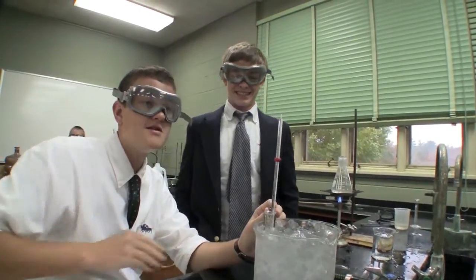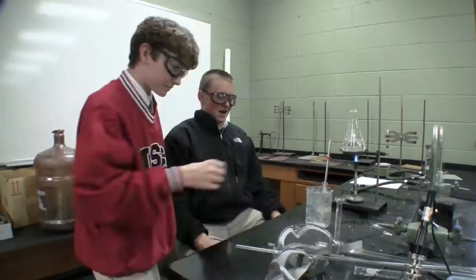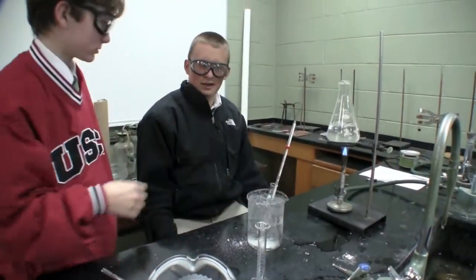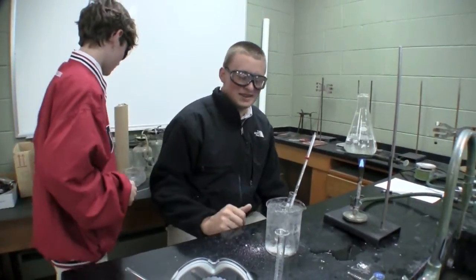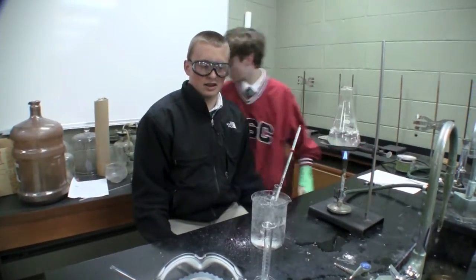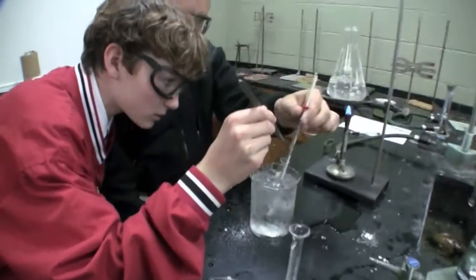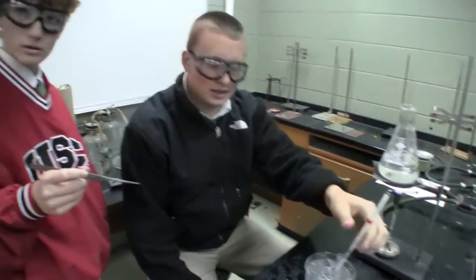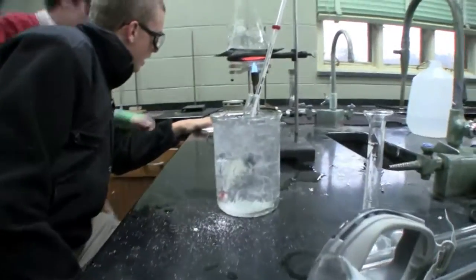My genius lab partner dumped the salt container in there. Alright, what are you guys doing? We are trying to find the different solubilities and how temperature affects the solubility of a salt in solution. What temperature are you at right now? We are currently at one degree Celsius. And how many milliliters of water? Eight milliliters of water.